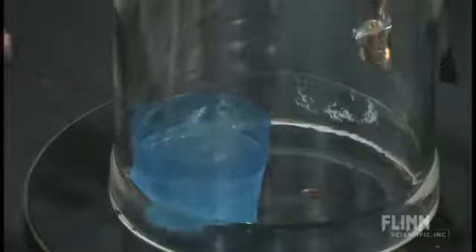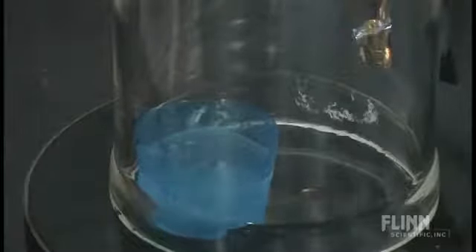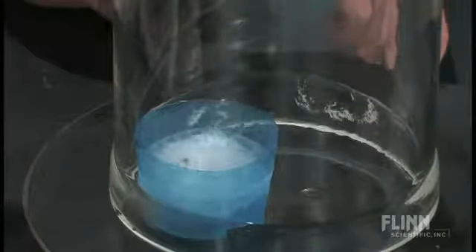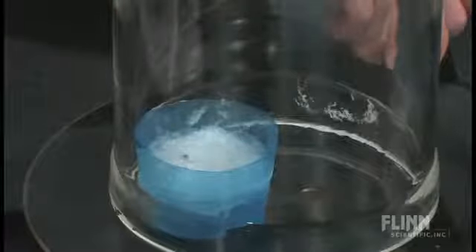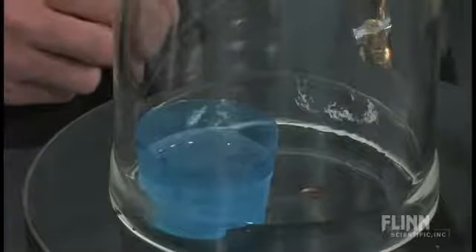We've cut off the bottom of a plastic solo cup. I would recommend a bluish background, like a children's cereal bowl, which is what I use in my classroom. And there's the solid. And now what I want to do is see if we can get it to stay. I want to slowly let the air back in there. And I'm going to cut the vacuum pump off. Jeff, cut the vacuum pump off, please. And you can see it go back to melting very, very slowly.